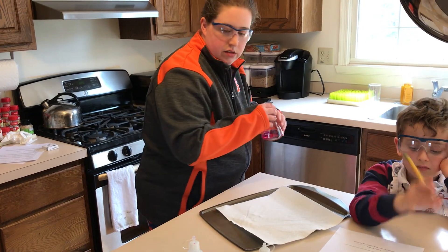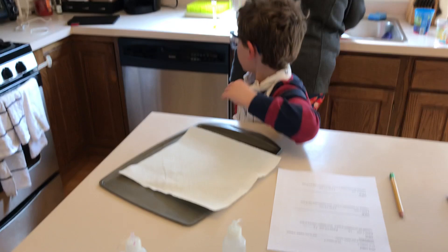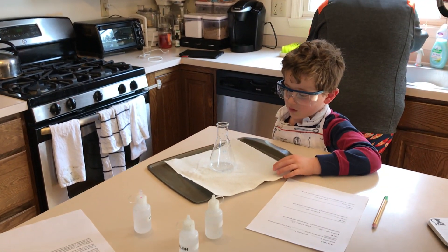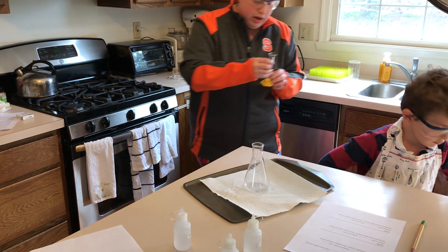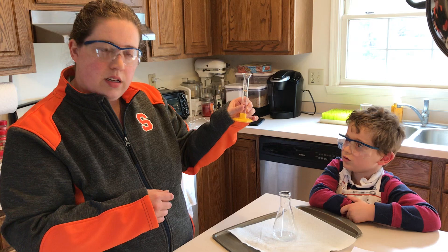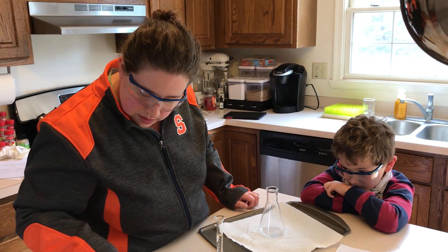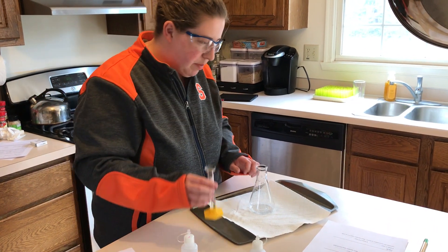So let's clean up and get ready for the next trial. Do you know what this is called? Graduated cylinder? Yes — that measures the water. So it says repeat trial two, but this time we are going to use 20 drops of acid.